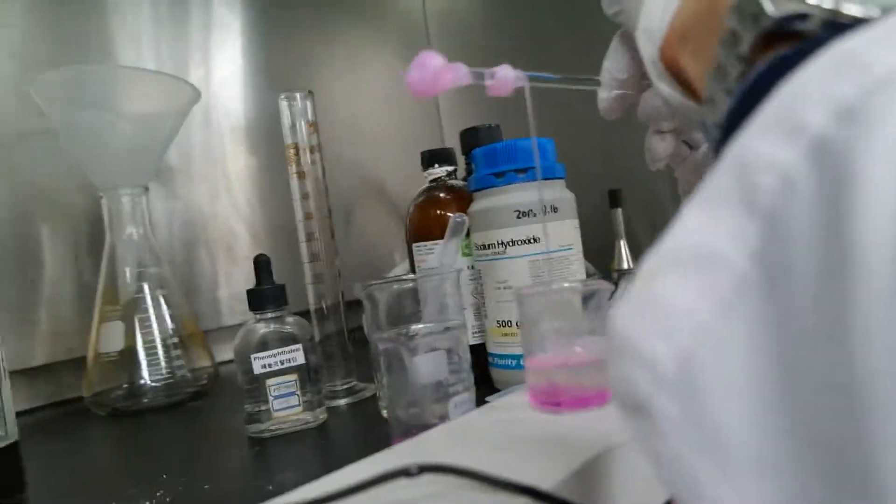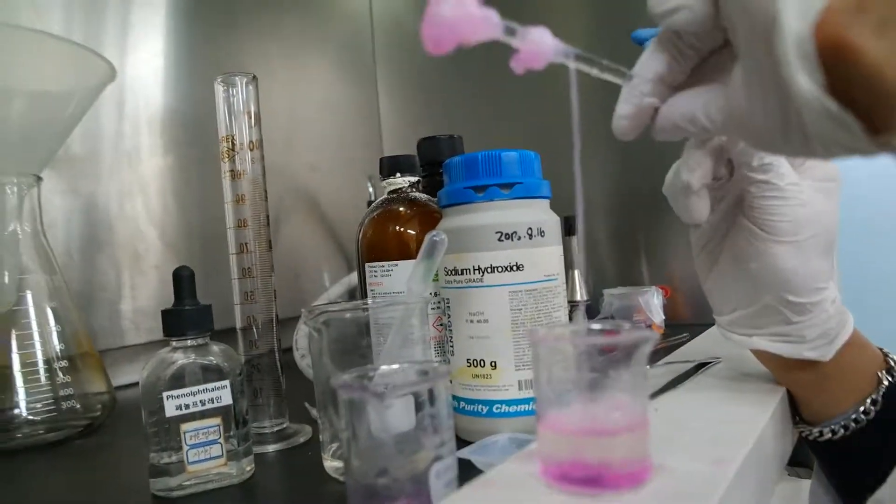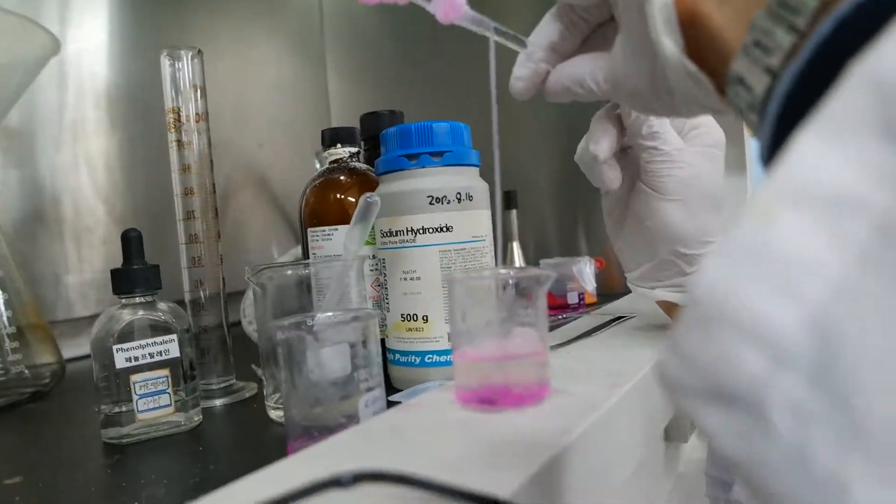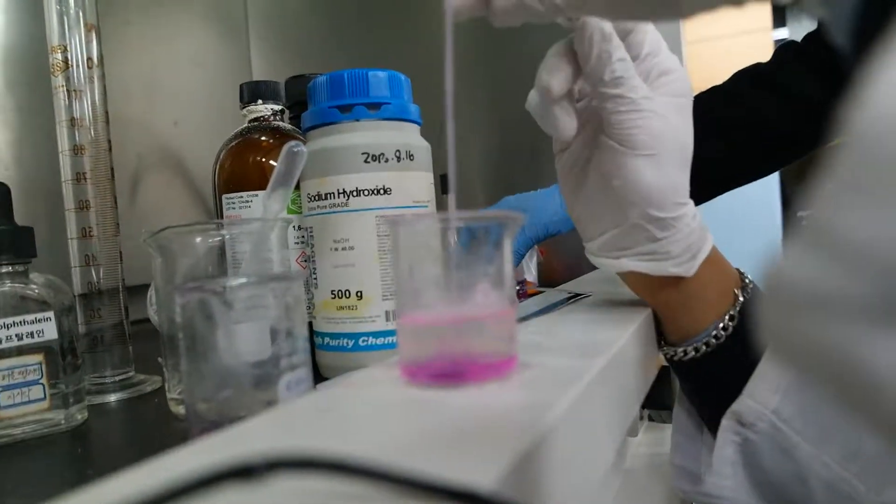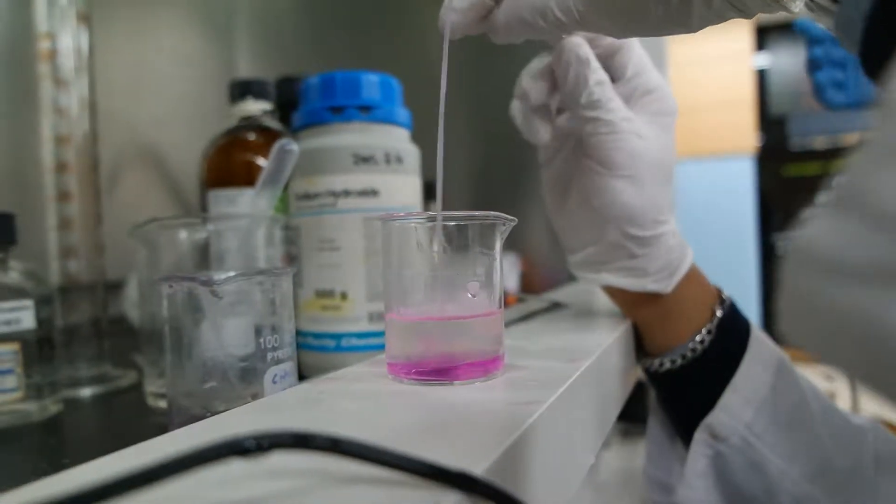We succeeded. I wonder if we could recycle this next time or whether we have to make a new one. We'll see. Oh, is it like covering? What is it?